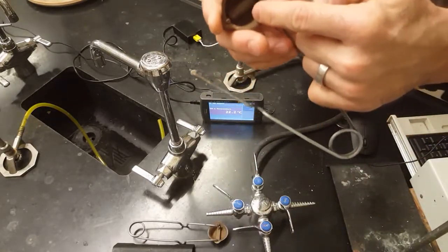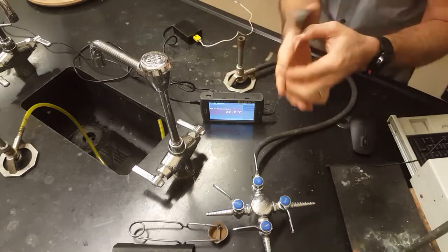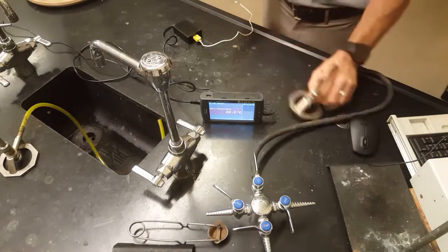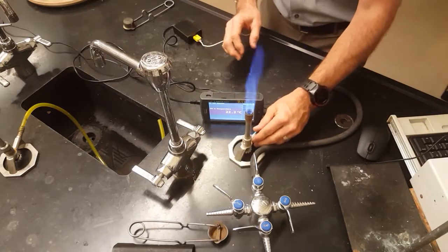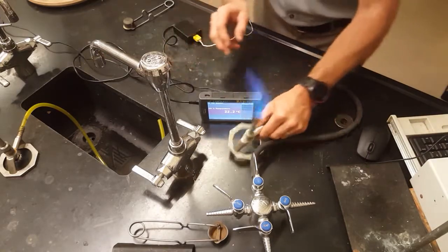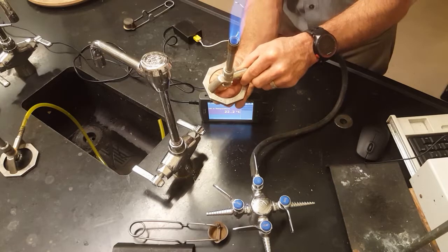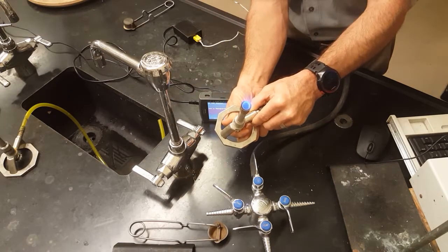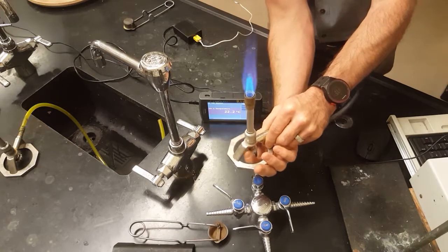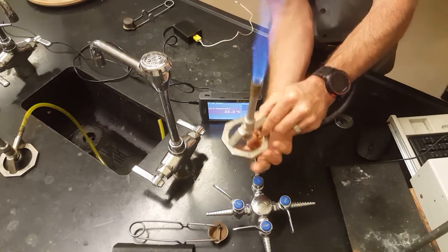Let's light the Bunsen burner. Nice, I like it. So you can see I can turn the flame down by going righty tighty, and I can turn the flame up by going lefty loosey from looking from the bottom.